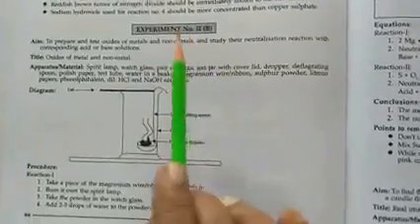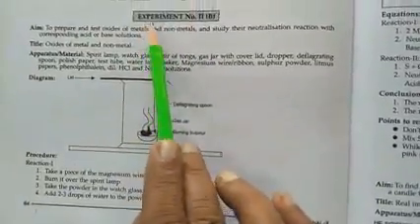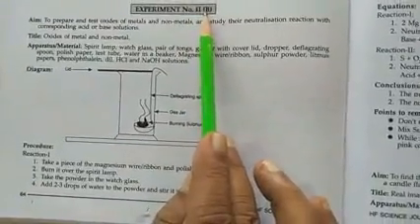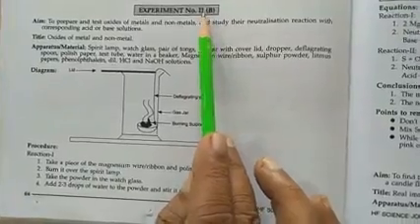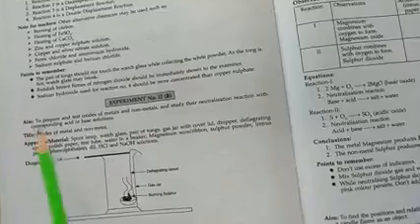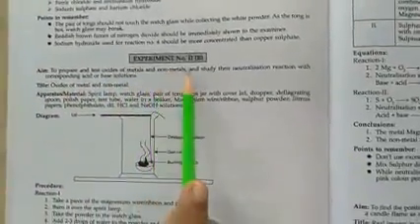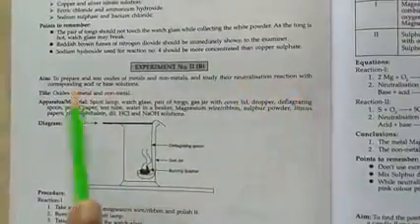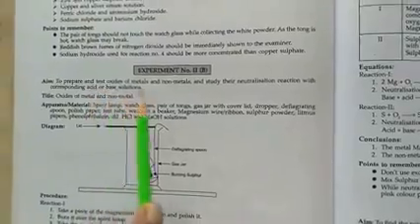Welcome to science practical. Today you are going to study experiment number 2B. This experiment is one of the long experiments from group B and it carries 8 marks. You are going to study how to prepare and test oxides of metals and non-metals and study their neutralization reaction with corresponding acid or base solutions.